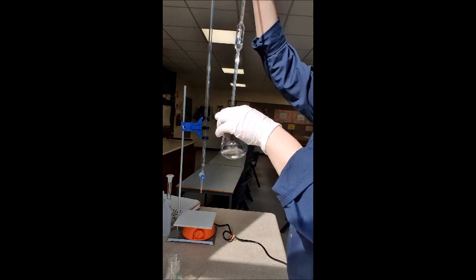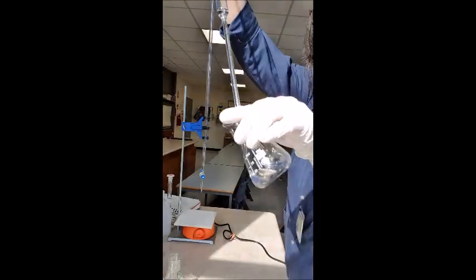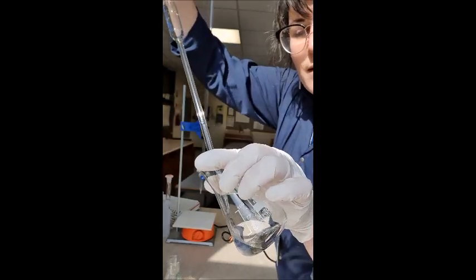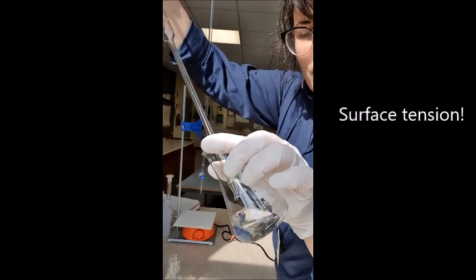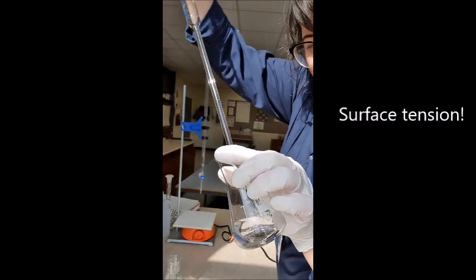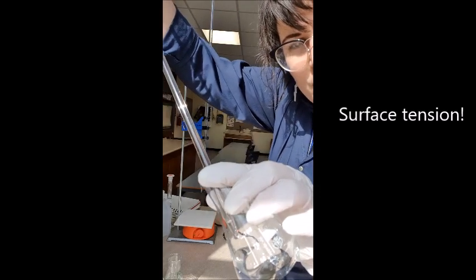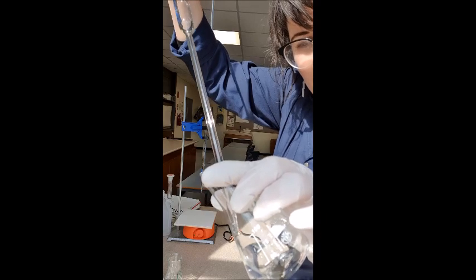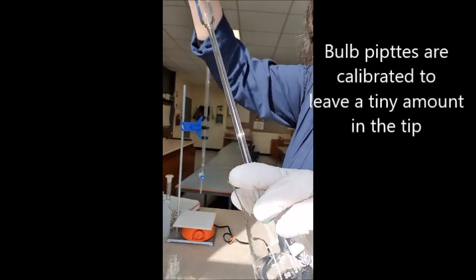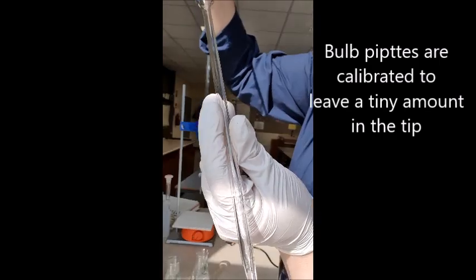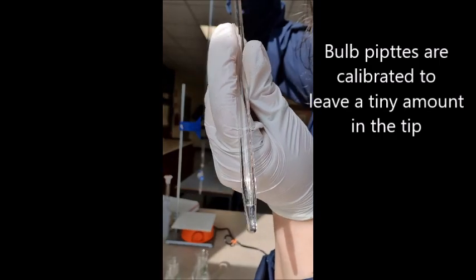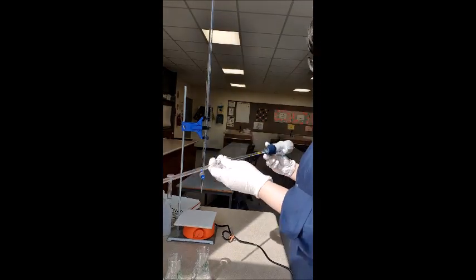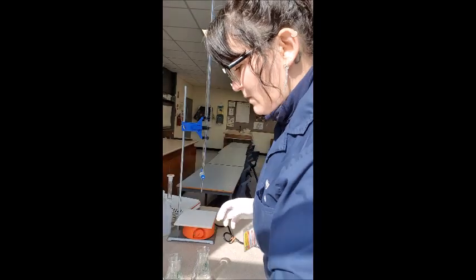Now when emptying your pipette, it's good to do it on an angle and you slightly touch the pipette onto the glass because it actually pulls it out. See it only empties to that much. But if I touch it, it empties that slightly bit more just to get it all out. Now these pipettes are calibrated, so you always have this tiny bit of liquid left in them. That does not matter. They're calibrated to keep that in there.